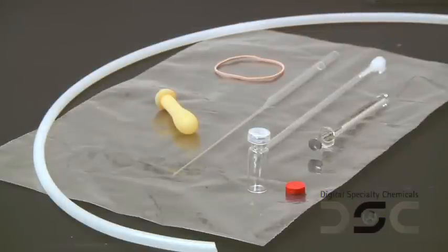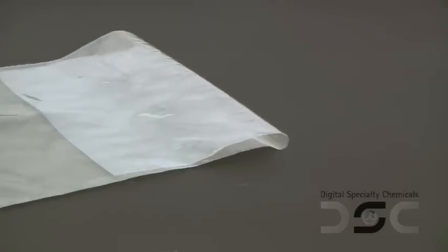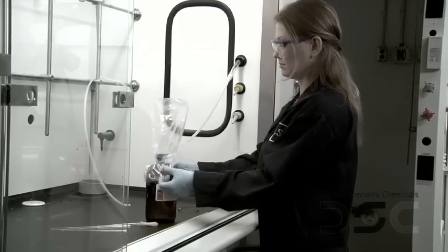The equipment required for this technique is simple: a standard glass pipette with bulb, a nitrogen or argon line, and a clear plastic bag — we find a 20 cm by 30 cm size bag is preferred.